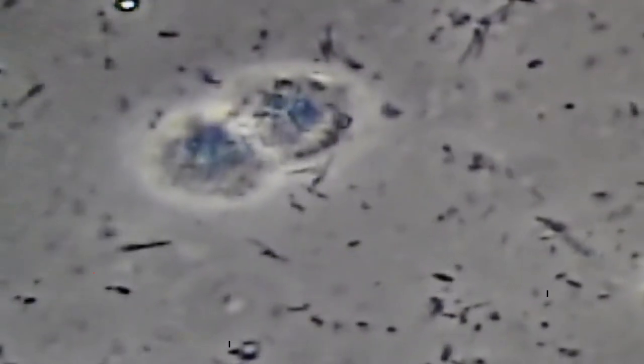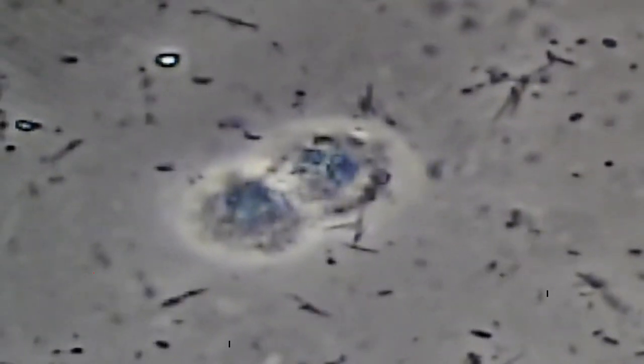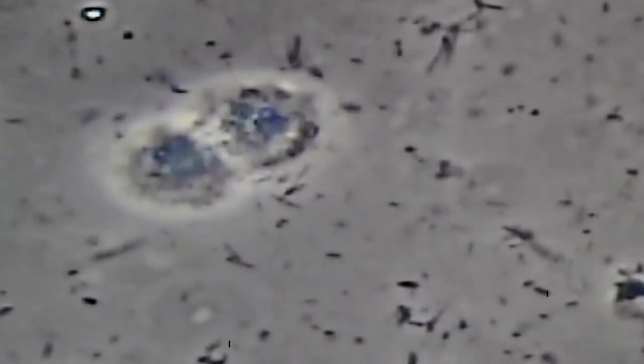This is a slightly active slide, not too bad. We'd like to see a little less activity in a slide like this. The more problematic bacteria are ones that are more motile and moving around a lot. We would prefer to see a slide where there's just not much going on and everything is pretty quiet.